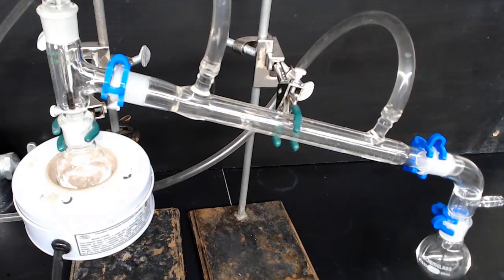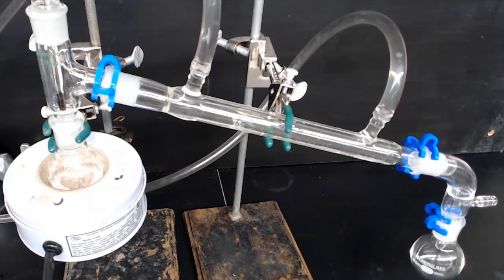If you're distilling a high boiling liquid, it's useful to wrap the hot parts of the apparatus in glass wool. However, tert-butyl chloride boils at a very low temperature, 50 degrees C, and it's better here to leave the glass wool off so we can see what's going on in the flask.